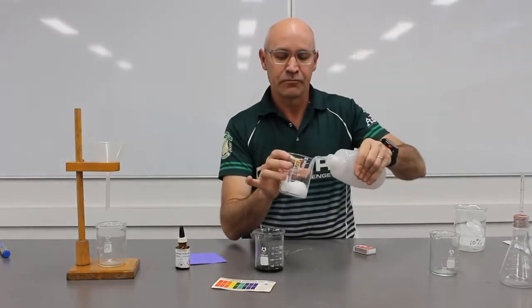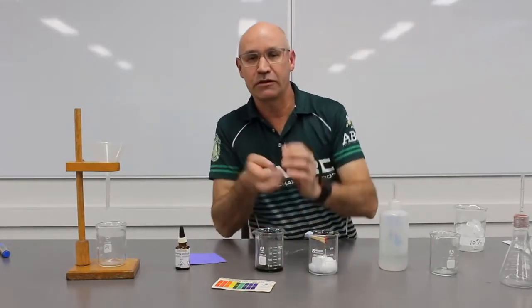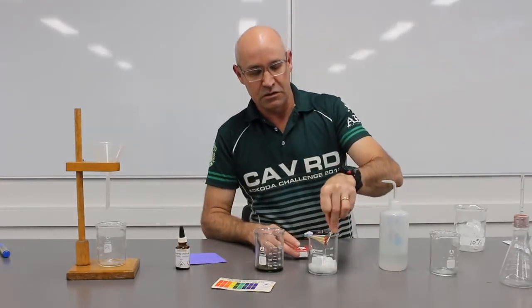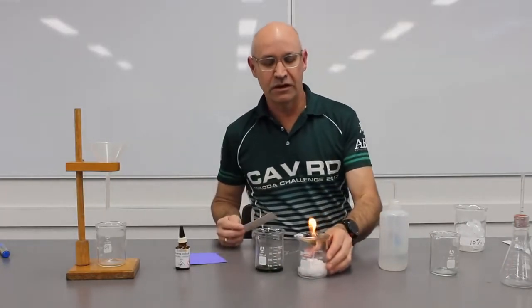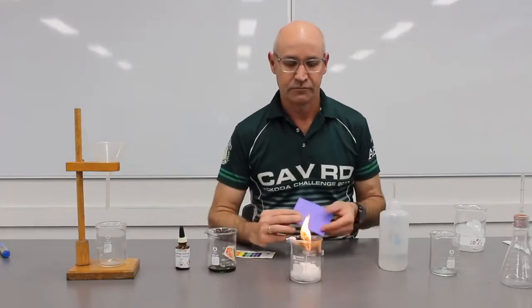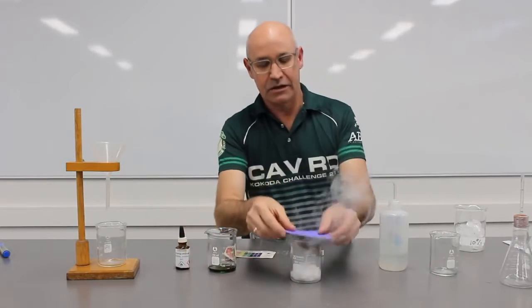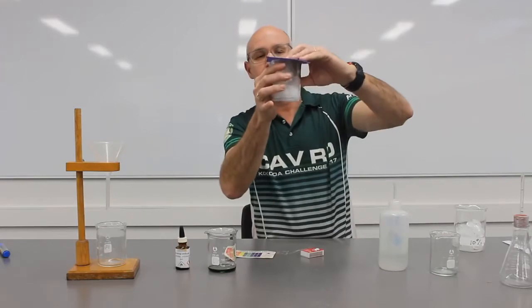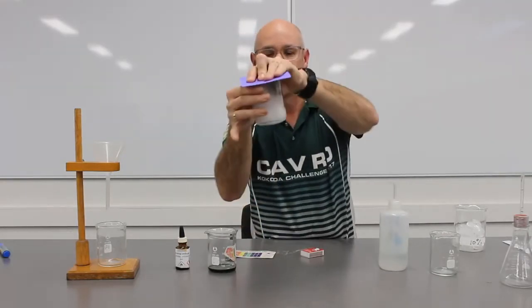Okay, now I'm going to produce some carbon dioxide. I'm going to do that purely by burning some matches. Okay, here we go. And they're off. Just going to let that burn for a little while. And blow it out. And I'm going to capture all of that smoke. Really mainly interested in the carbon dioxide there. So let that all absorb.